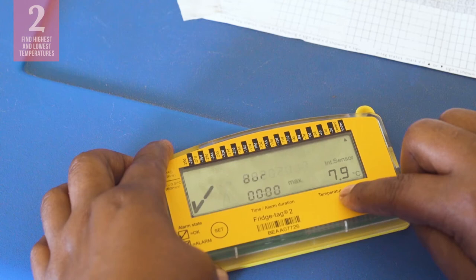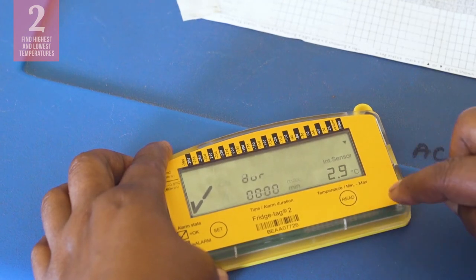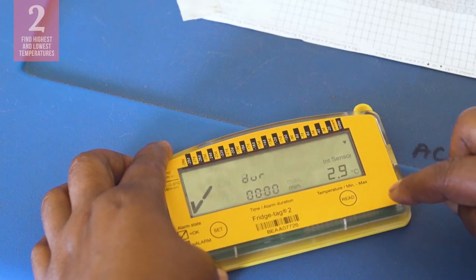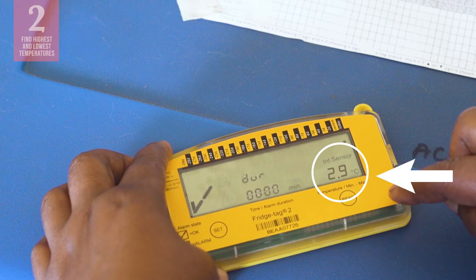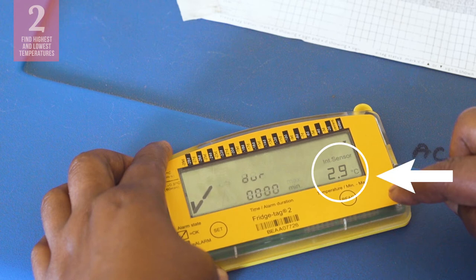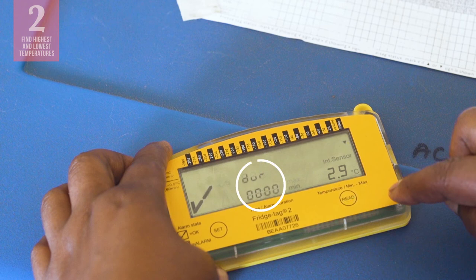If we push the Read button again, we see that the lowest temperature today was 2.9 degrees Celsius. Again, you will notice that the time reading is zero, indicating that temperatures were never too low.